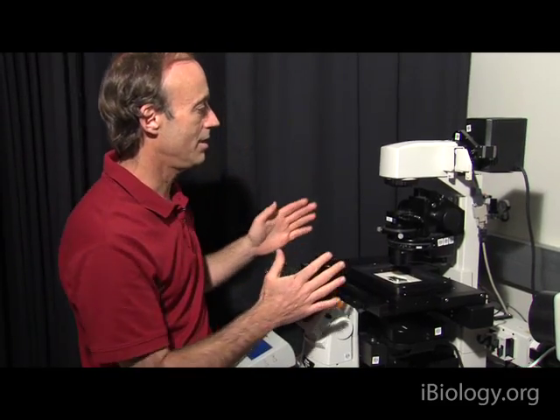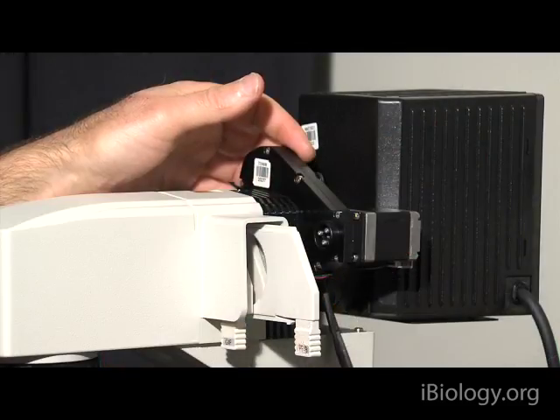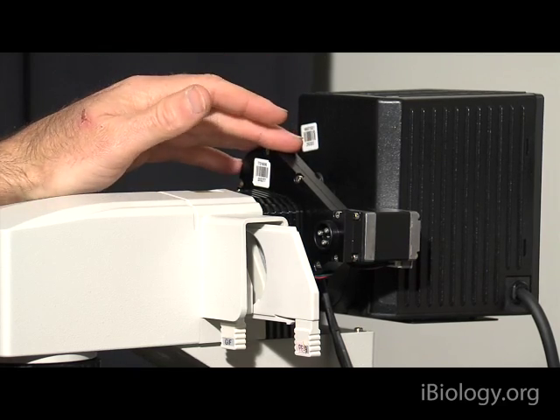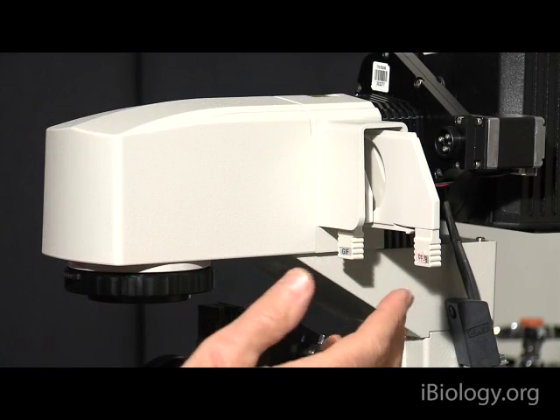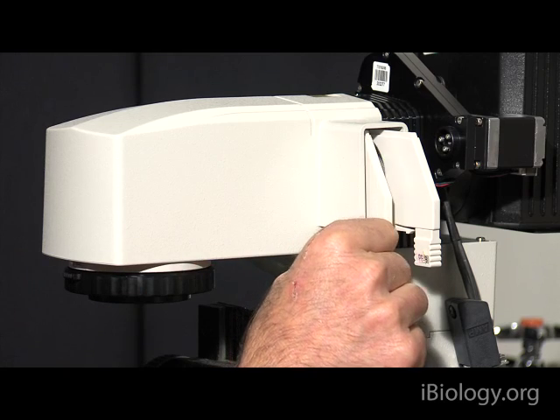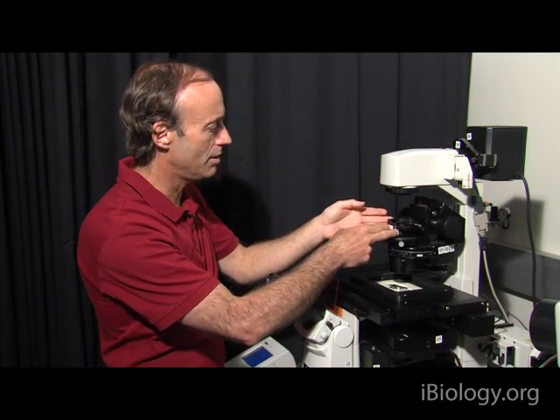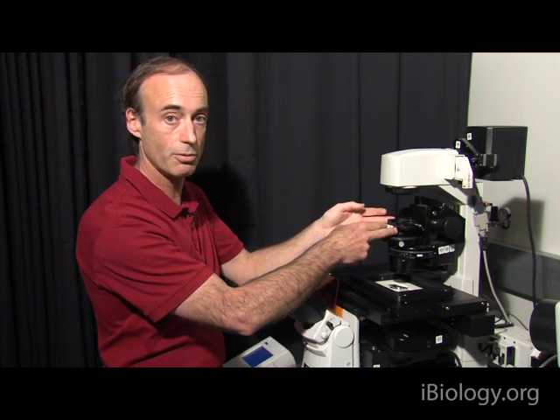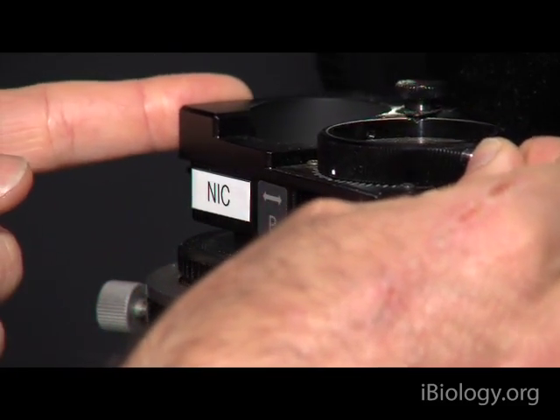The next thing is to look at the system and make sure everything is set up properly for bright field microscopy. First of all, there's an automatic shutter here, so I'm going to make sure that's open — I can tell it's open if I can see light. There are various filters here: a green filter and a neutral density filter. For the start, I'm just going to take those out of the light path. Here's a polarizer, which we'll need for DIC microscopy, but right now I'm going to make sure it's out of the system for bright field.